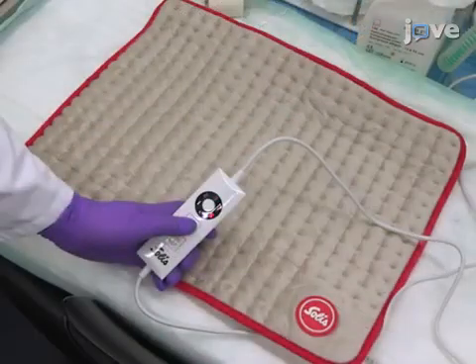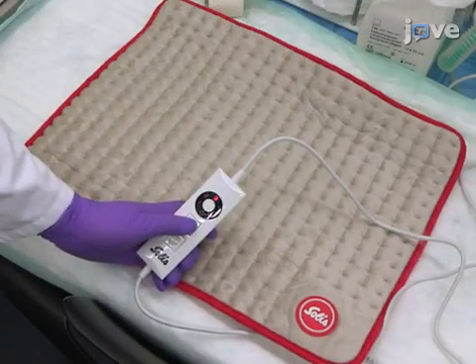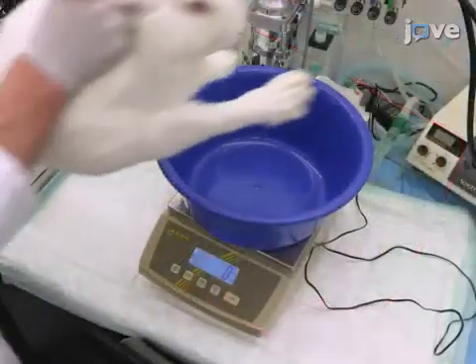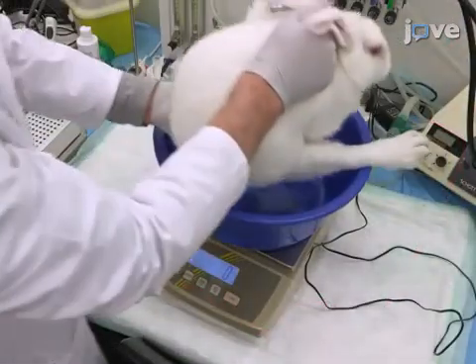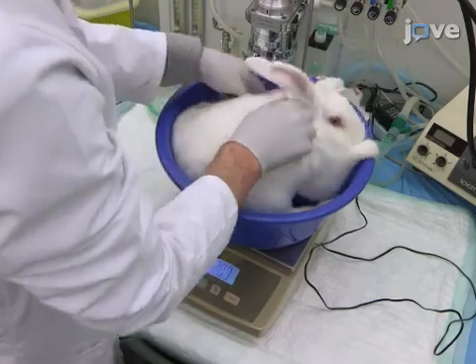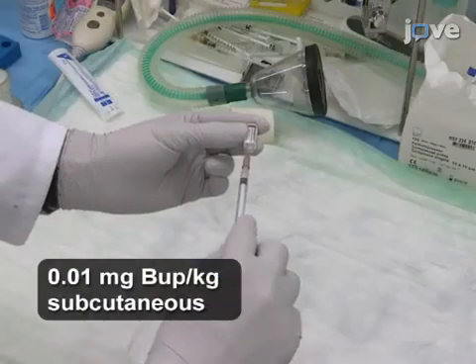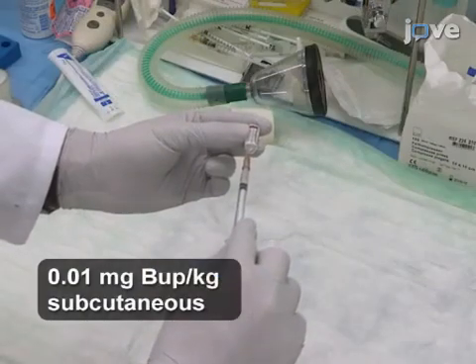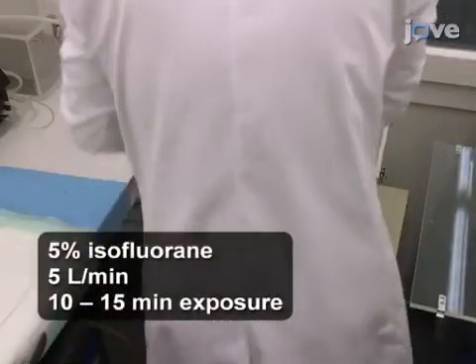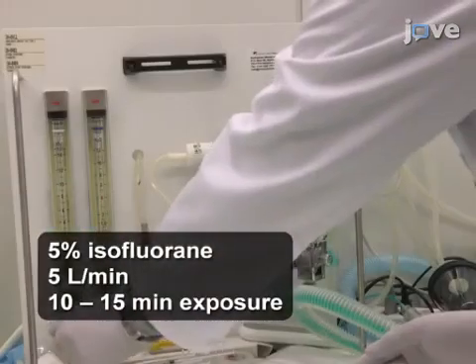Next, set the thermopad at the surgical platform to 37 degrees Celsius. Then weigh the rabbit. Next, provide an injection of buprenorphine and anesthetize the rabbit using 5% isoflurane at 5 liters per minute for 10 to 15 minutes.